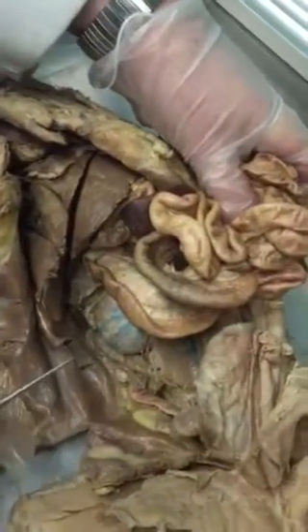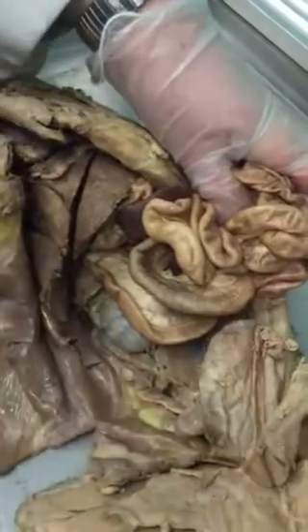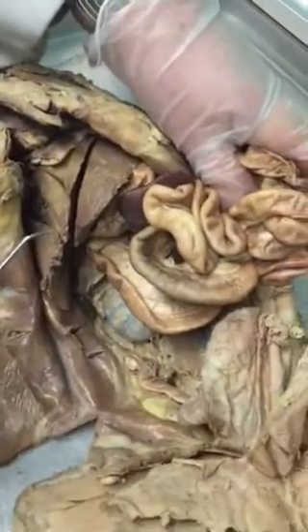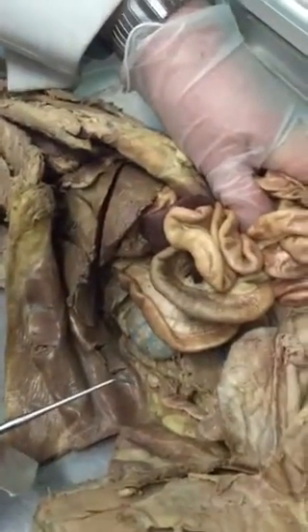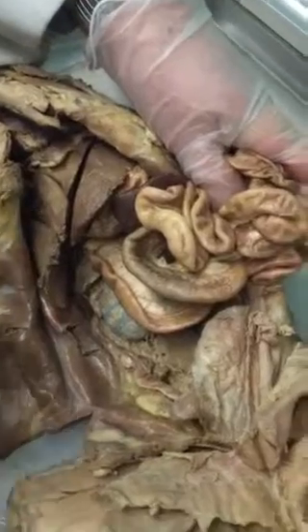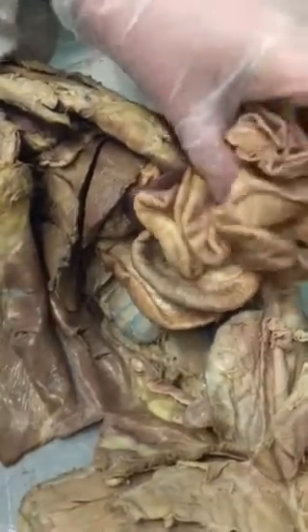So we have to put the orientation in terms of the cat. Right, but only on the organs I wrote on the board, like the kidney, the liver, and the ovaries. Like you don't have to write left sartorius muscle, right biceps brachii. Just those organs that have 2. I guess it would take forever if every muscle you had to write left or right.